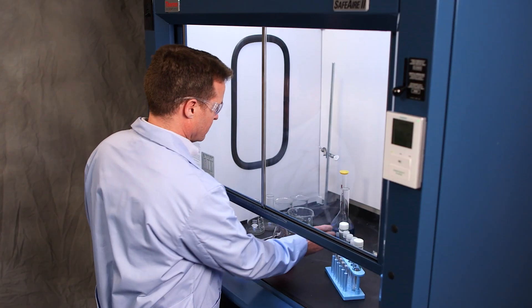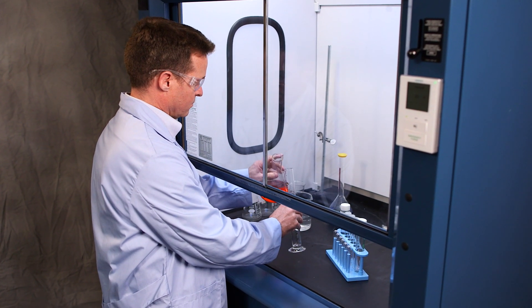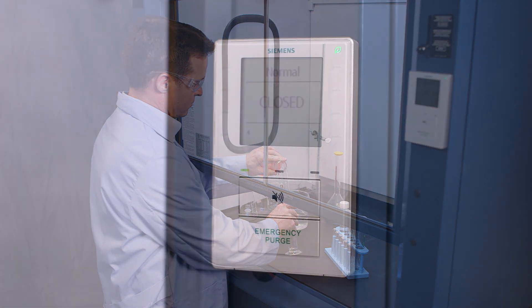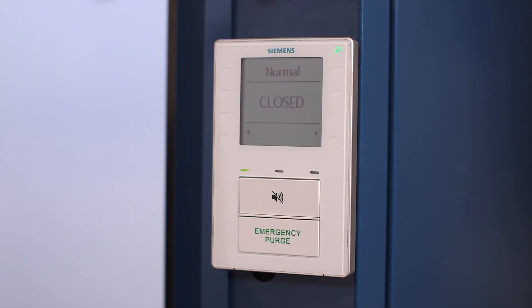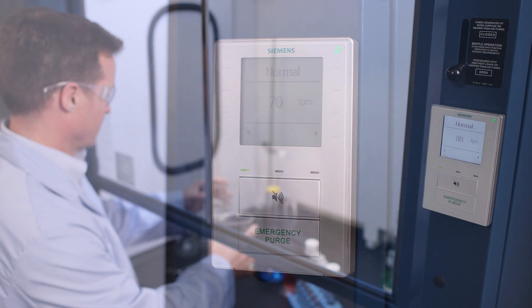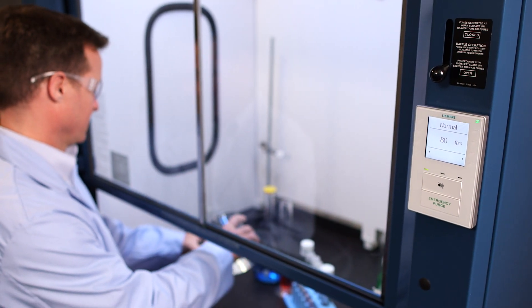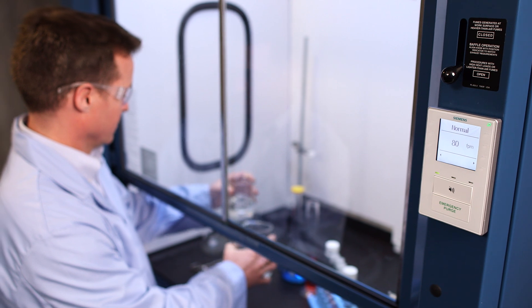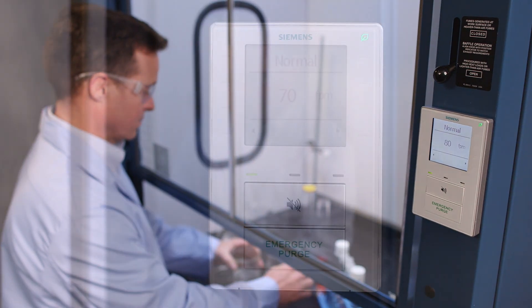The Siemens Operator Display Panel assures the hood user of its proper working status and, when necessary, alerts the user to potential problems. Let's look at a typical lab scenario using the Siemens ODP to see the basics of fume hood monitoring.